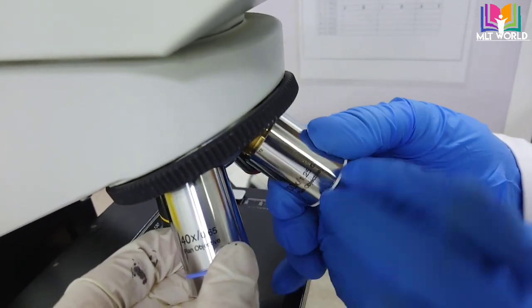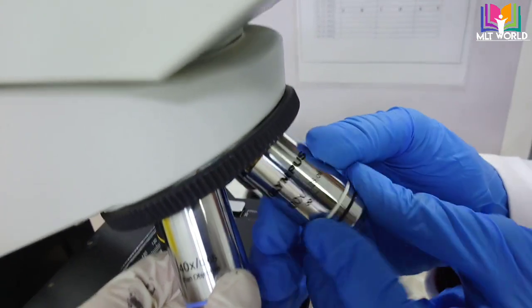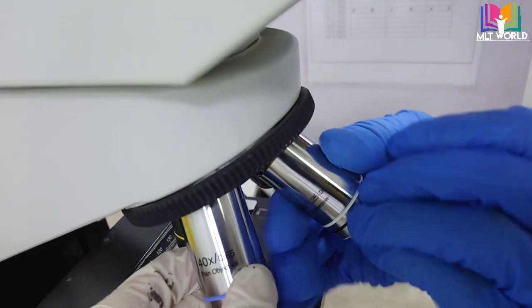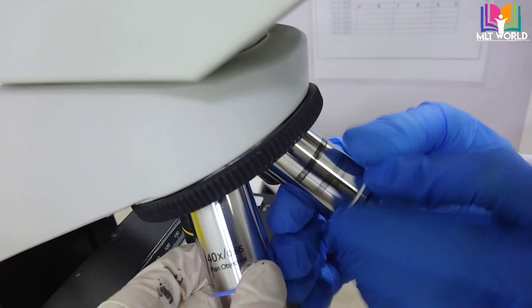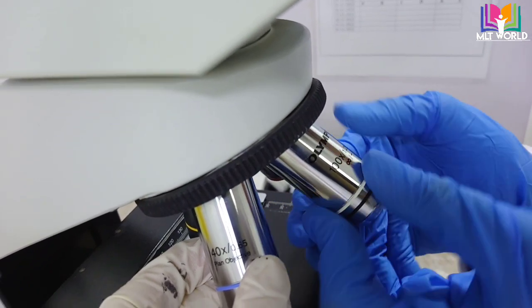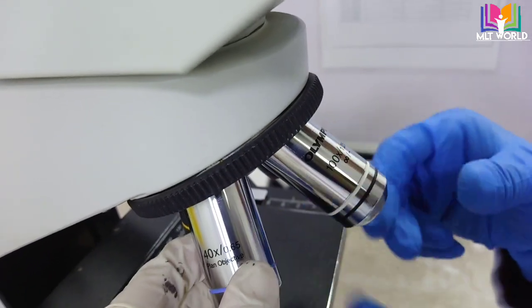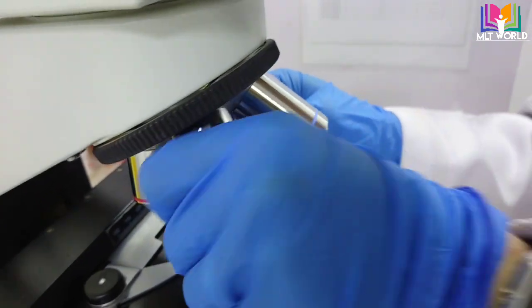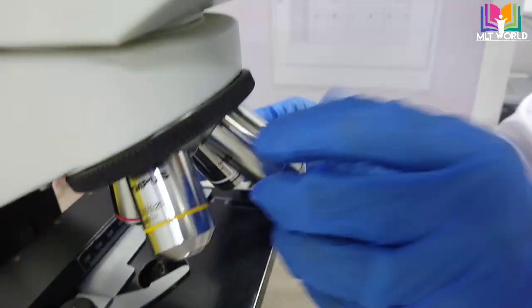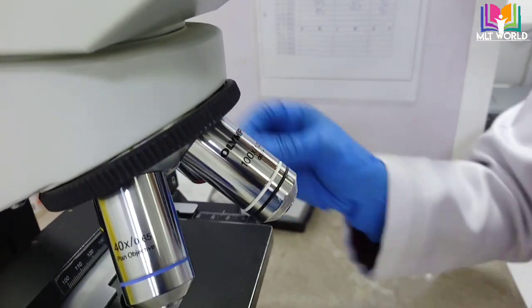Just remember: when opening, we have to move the lens anti-clockwise. And when we have to fix the lens back to the microscope, we have to move clockwise. Like that, we can clean the lens of the microscope.